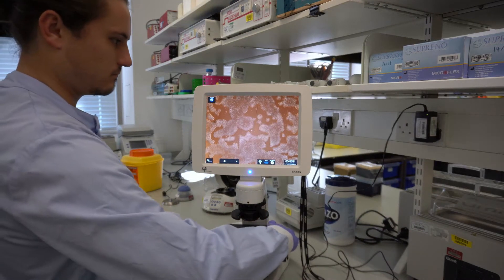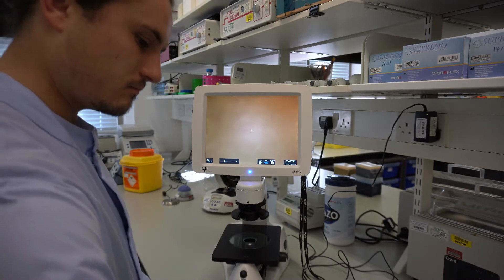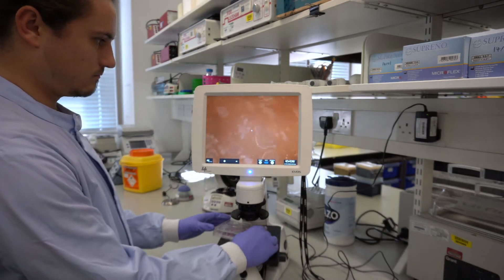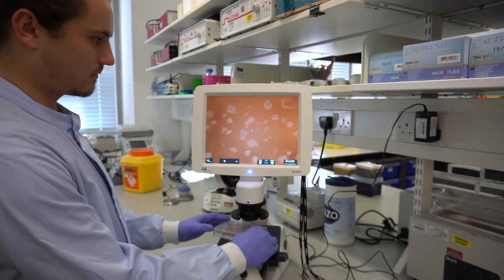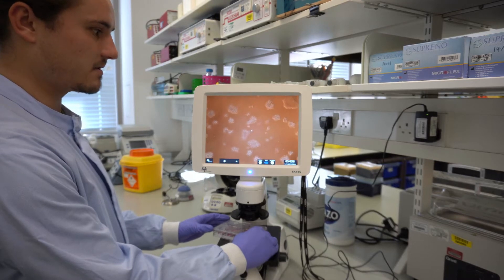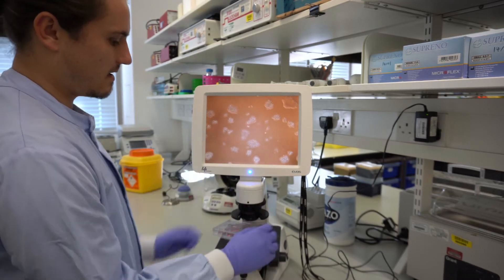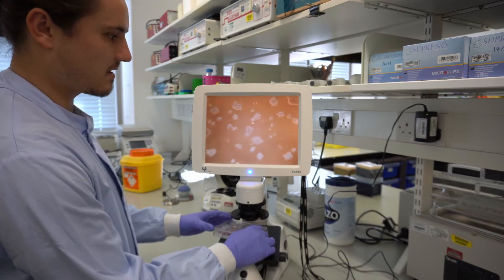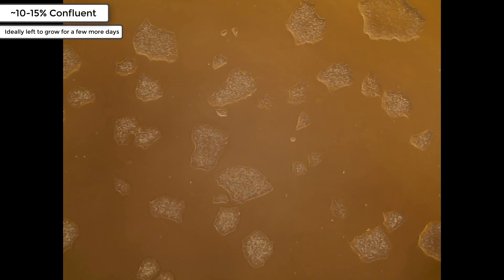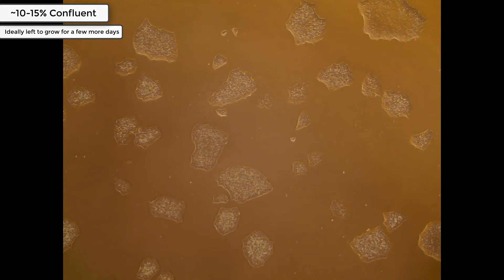Luke will now show an example of some very sparse cells. As you can see here, the colonies are very small, they're not really too compacted, and they're definitely not grouping together, so you would want to leave these at least another couple of days. These would be approximately 10-15% confluence and they're not ready to passage yet.